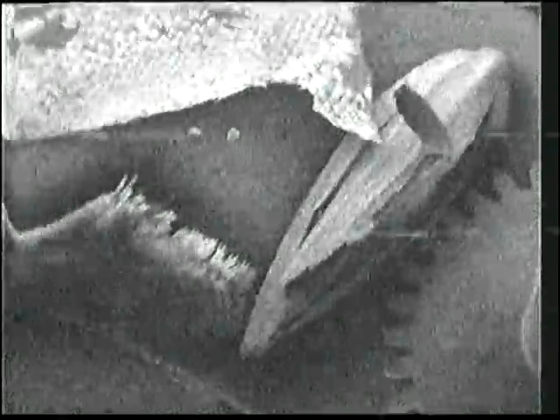Now we're going to move to a grass seed. And the grass seed looks like a fruit. It's got ends to it that look like corn stalks. You can see the ends are like corn stalks. This end in particular looks like it's a fruit. See the shape of that?